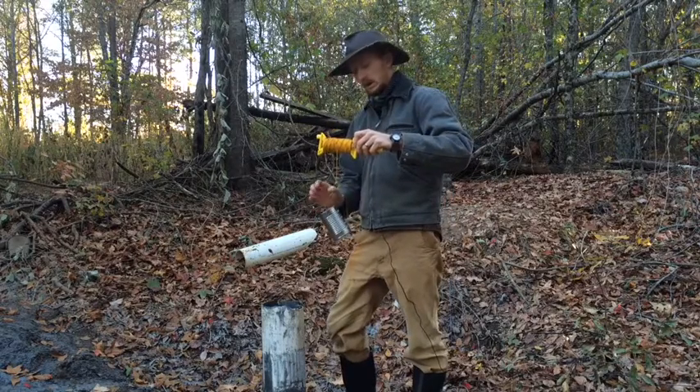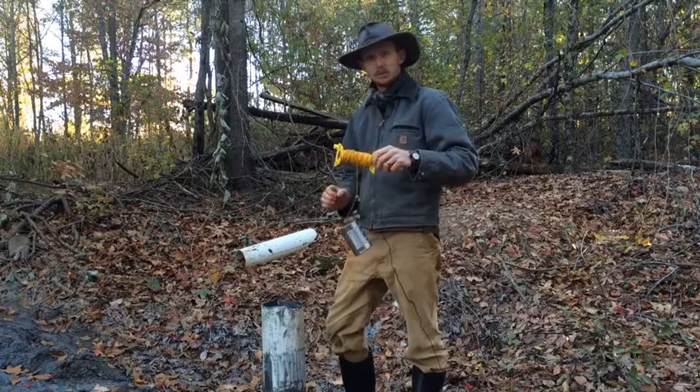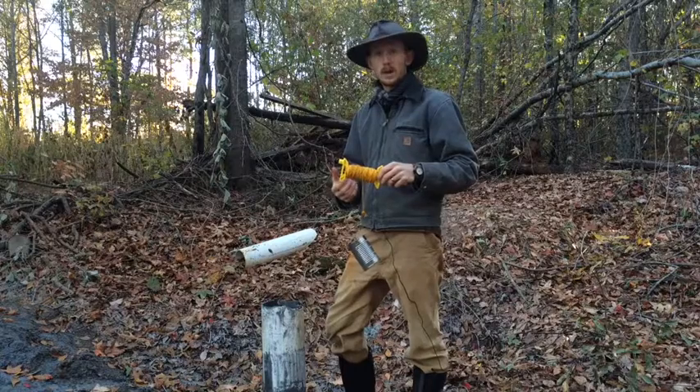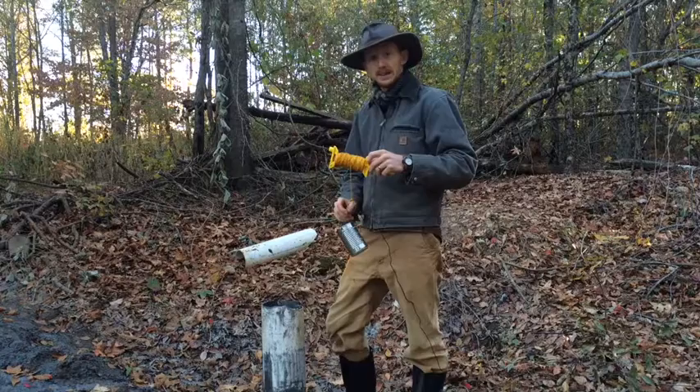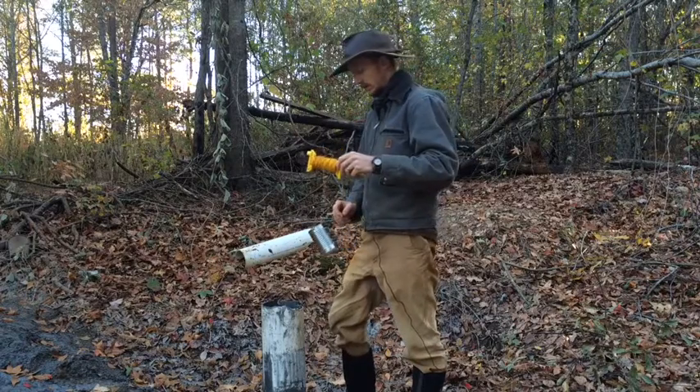The key is with your well, you want to keep it very sterile. We've had problems with iron bacteria in our other water, so with this well in particular, we're trying to keep things very clean and not get a lot of junk or other stuff down in the well.